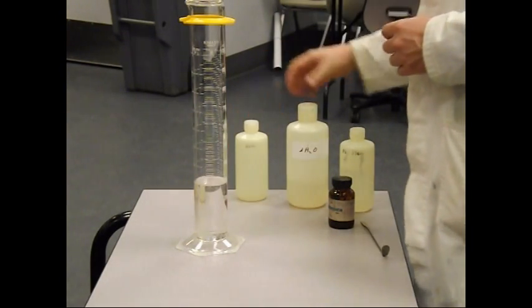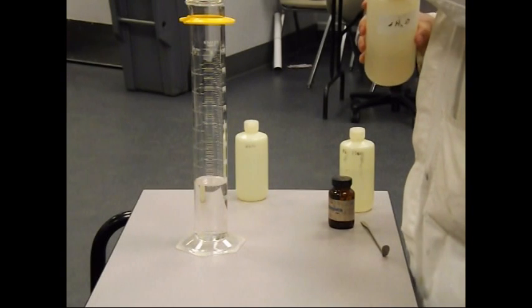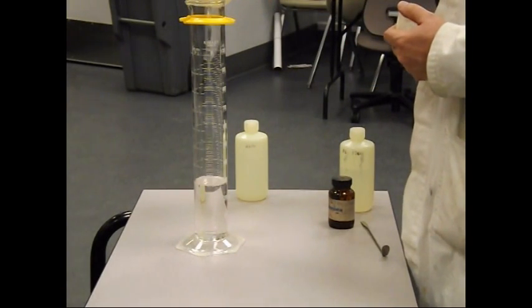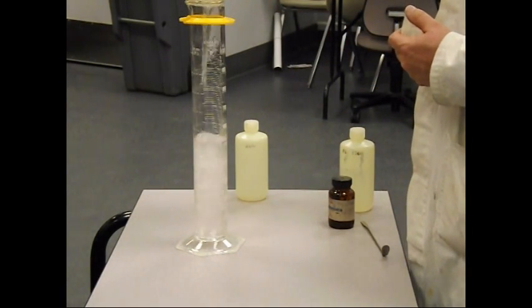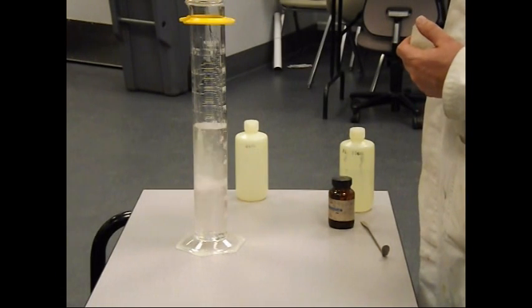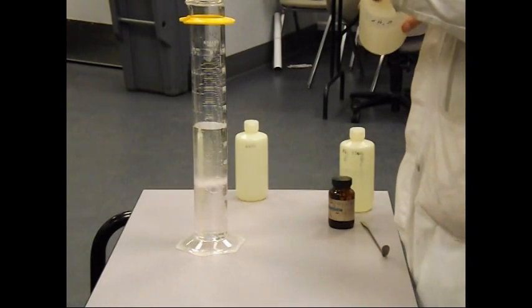Dichloromethane looks a lot like water, but it is not, so be careful with that. This one is water.